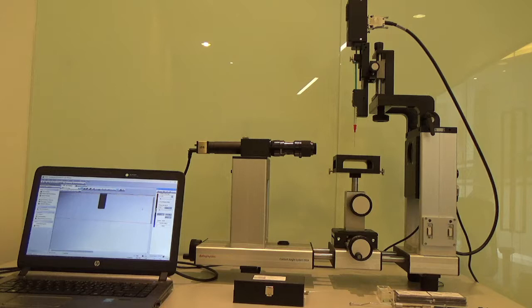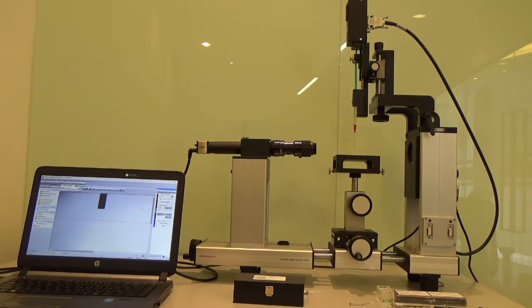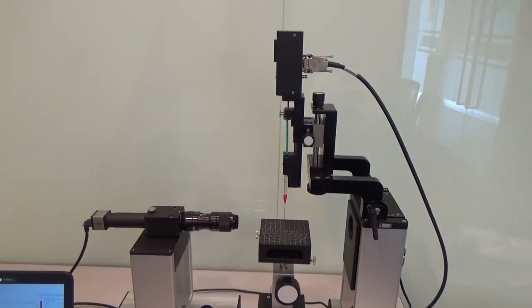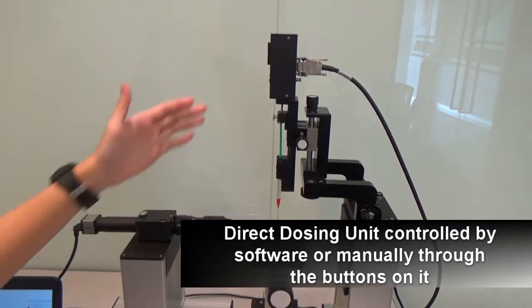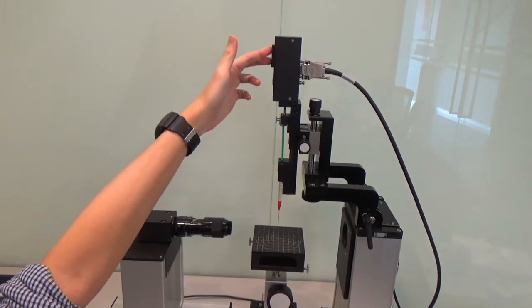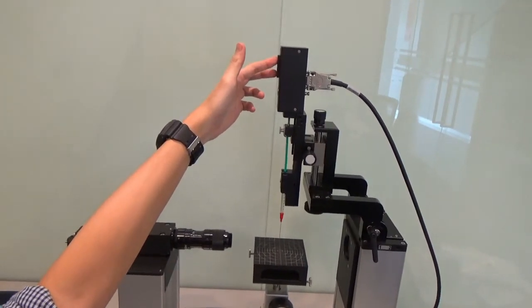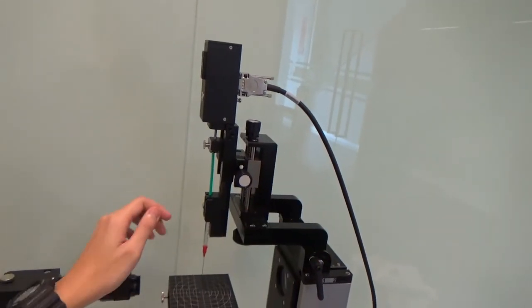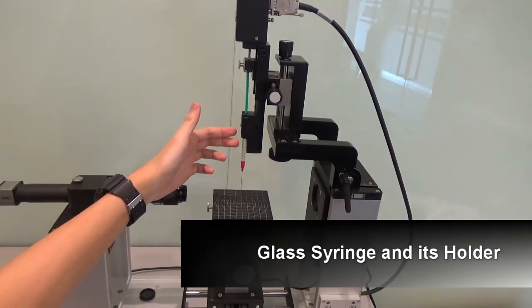Let us take a look at the standard hardware configuration for this OCA25. As you can see, there is a direct dosing unit with up and down buttons to control the motion manually, though normally it is controlled automatically through the software.